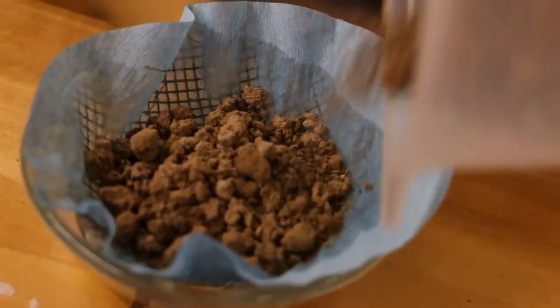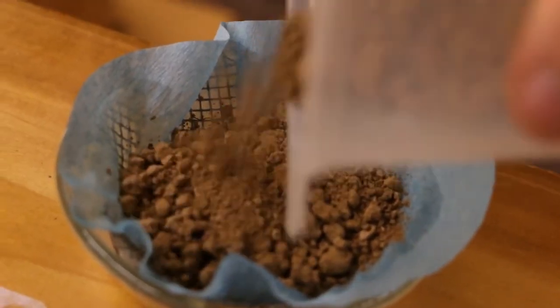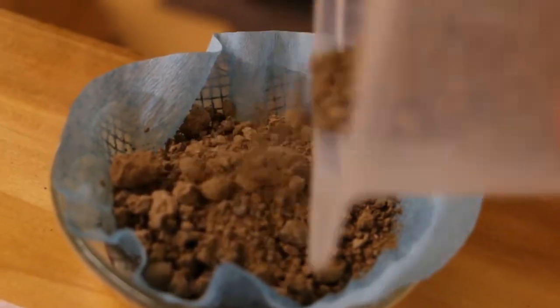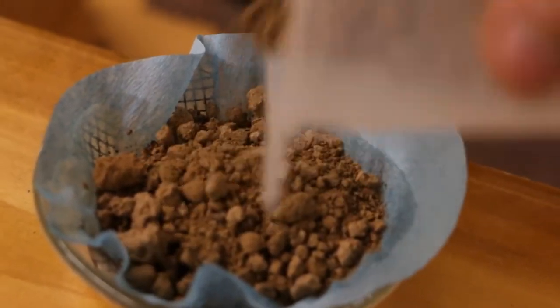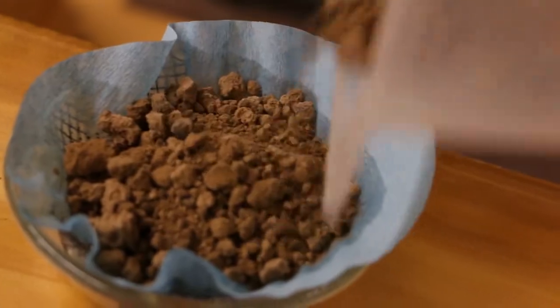And then add the soil. Depending on your project, you may want to sieve the soil a little more finely than is shown here. Nematodes that are protected in thicker soil aggregates might not get through.